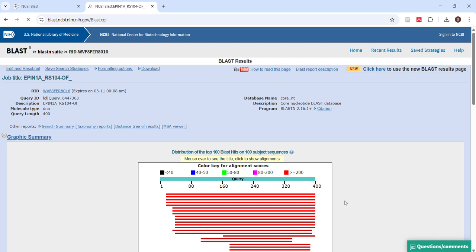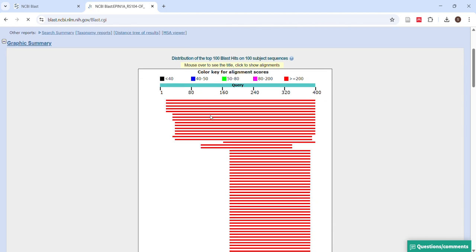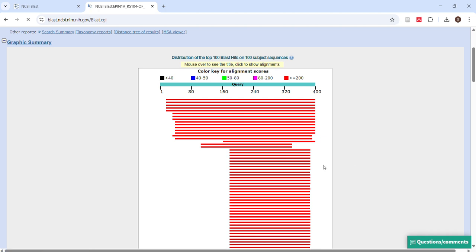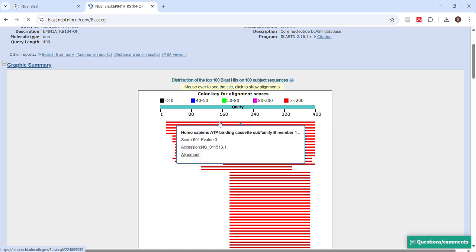Okay, so it will show me the query alignment scores, and here you must be knowing how to read all this, because if I start teaching this, it will be a very long video. So all that I will cover some other day. But if I just click at any of the red lines, I'll find out which gene or SNP, whatever it is, it is related to.